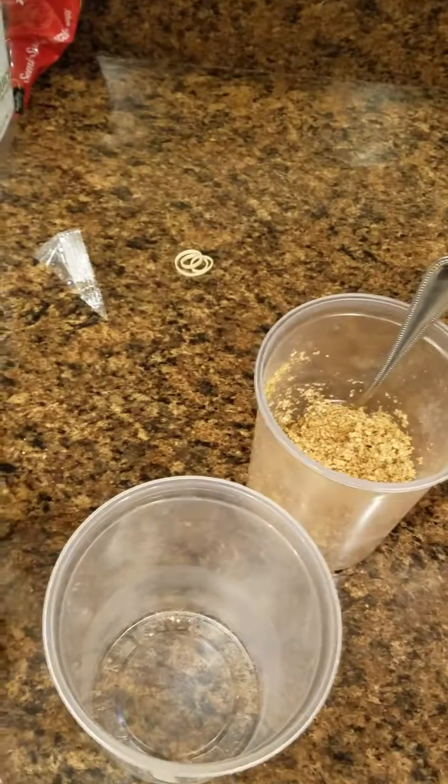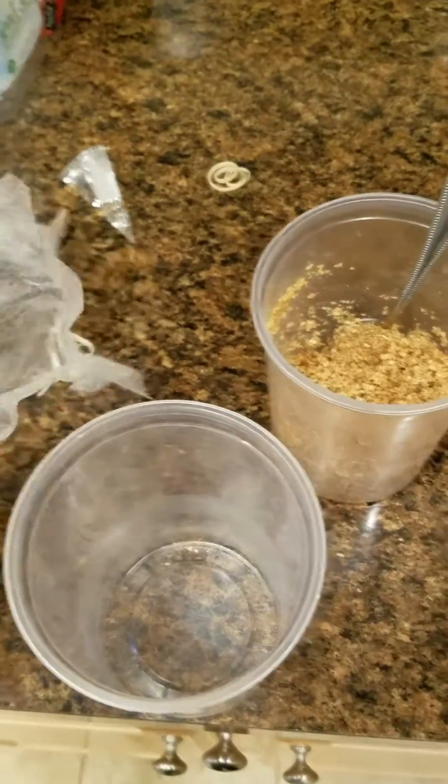So what I'm going to do is split them up. I just made some new media, and I'm going to place the new media in a cup.